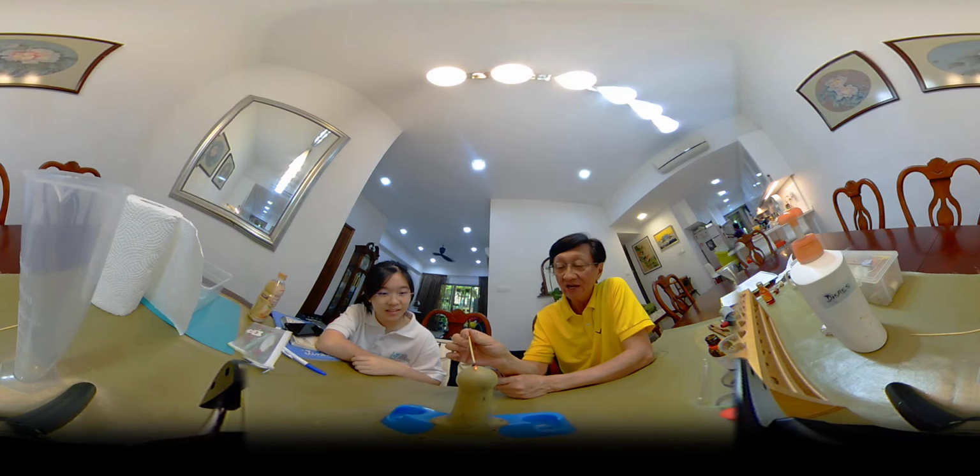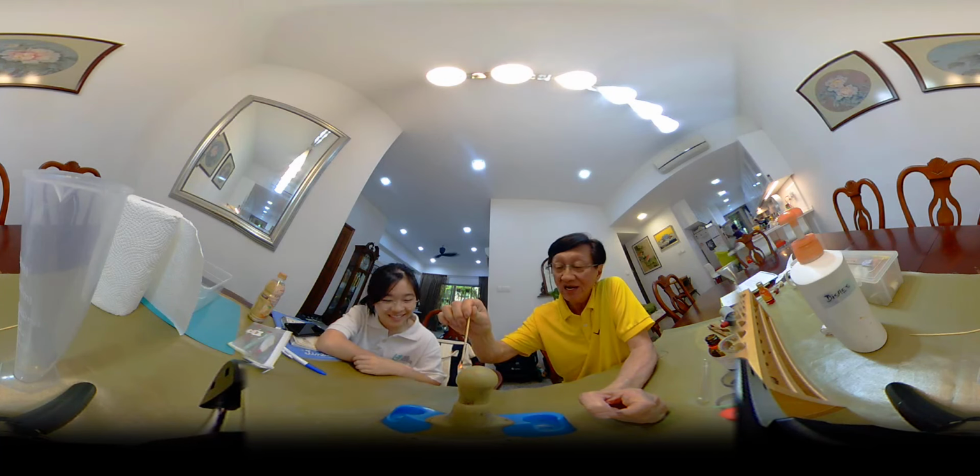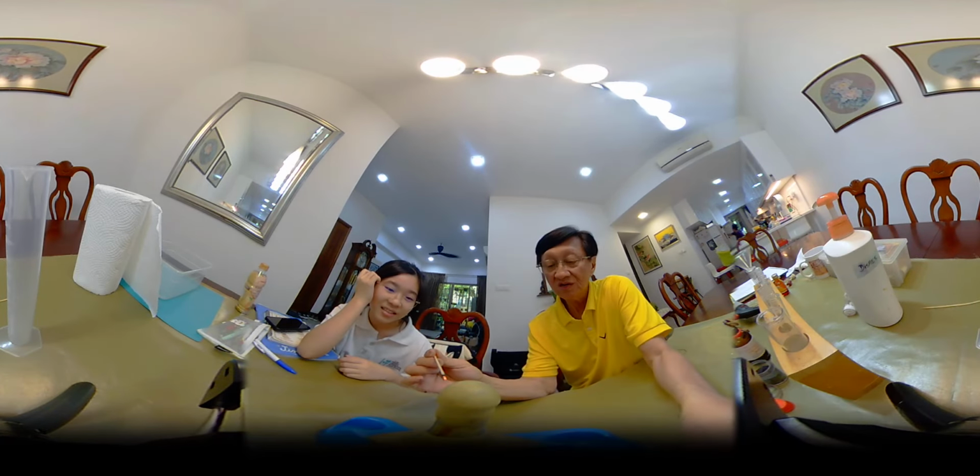It grows brighter, can you see? As the bubble bursts, can you see it grows brighter? Yeah. It only grows brighter.